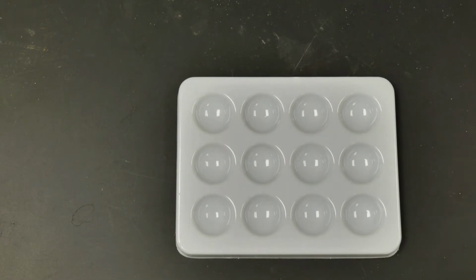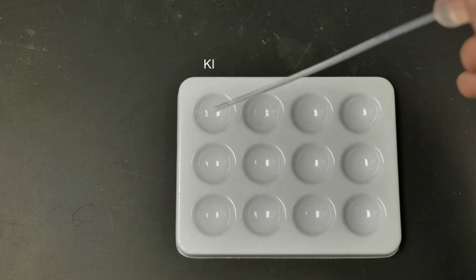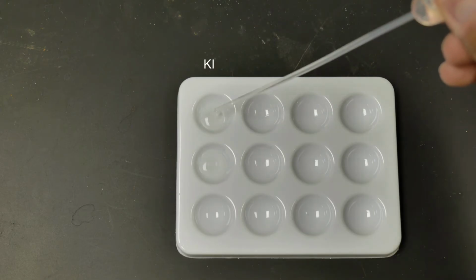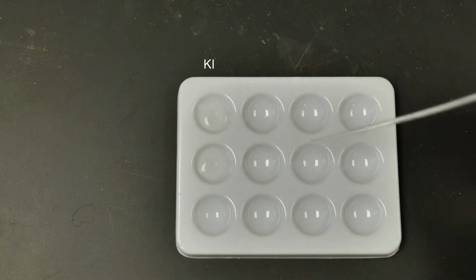All right, so we're here now with figure B, or part B of the lab, doing the cation analysis. We're going to fill up these first 2 spots with some potassium iodide solution. Okay, so we're going to add some here, again, into each one. Just make sure roughly each one has about the same. All right, and we're going to move on to fill up the next ones with the next chemicals.